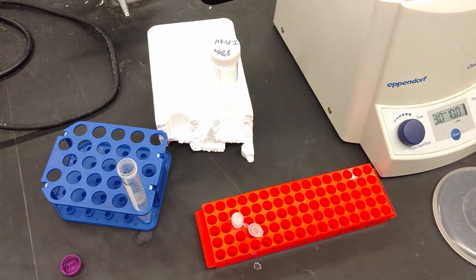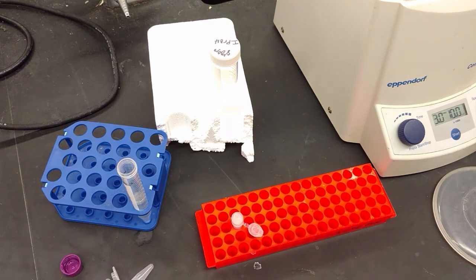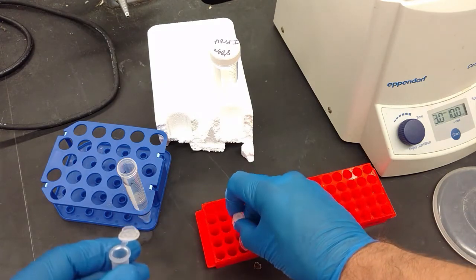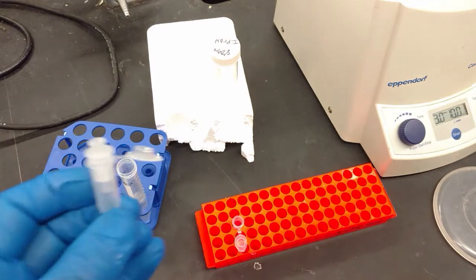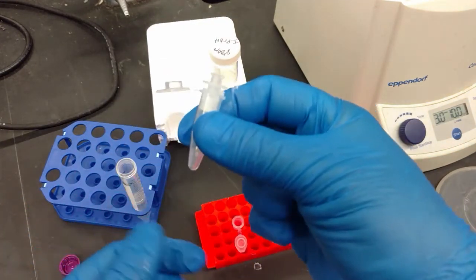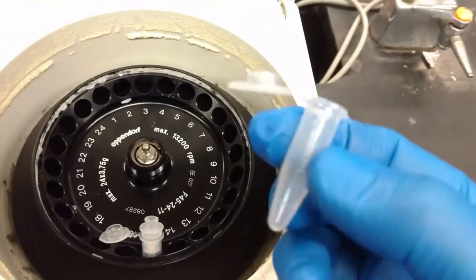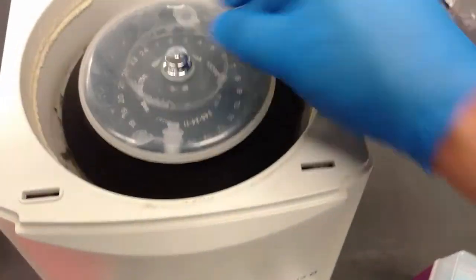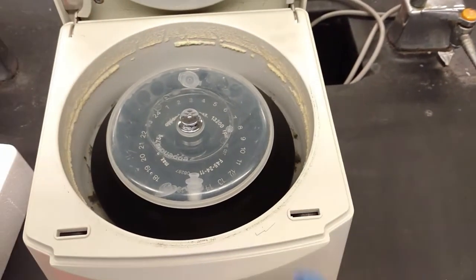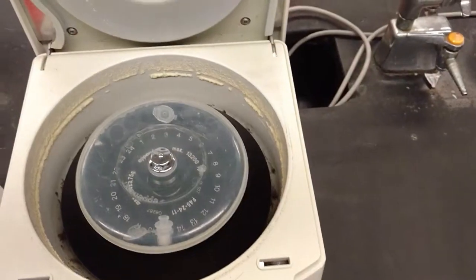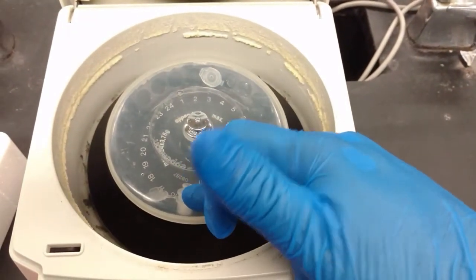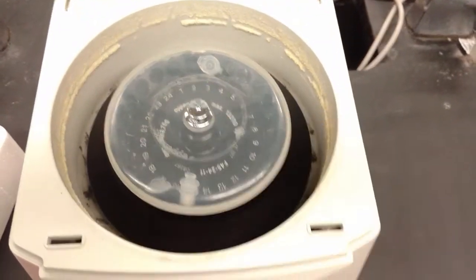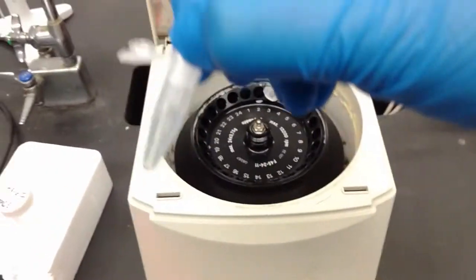So what you do is you're going to need four microcentrifuge tubes. First, you're going to put it, and go ahead and make sure you snap it in, on a microcentrifuge tube, a clean one. And you're going to spin it five minutes. And notice, fits in just fine. Take another microcentrifuge and just fill it with water. And you can put it opposite. The plastic lid will make sure that the cap doesn't come flying off. And you're going to spin it five minutes, 10,000. And that's going to pull isopropanol that's still off the tube, still on the column, off of it and into the tube.